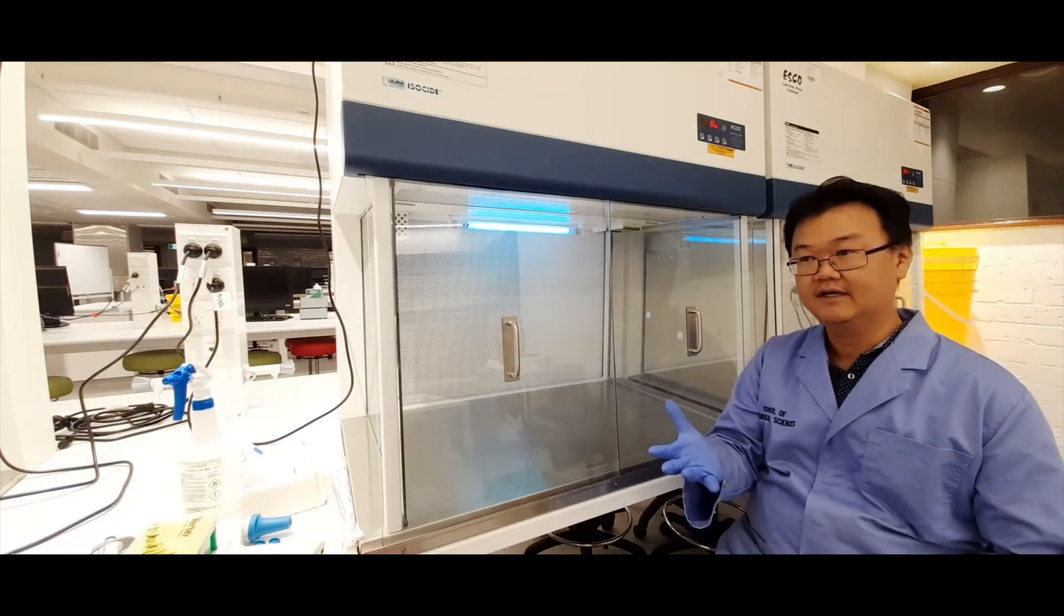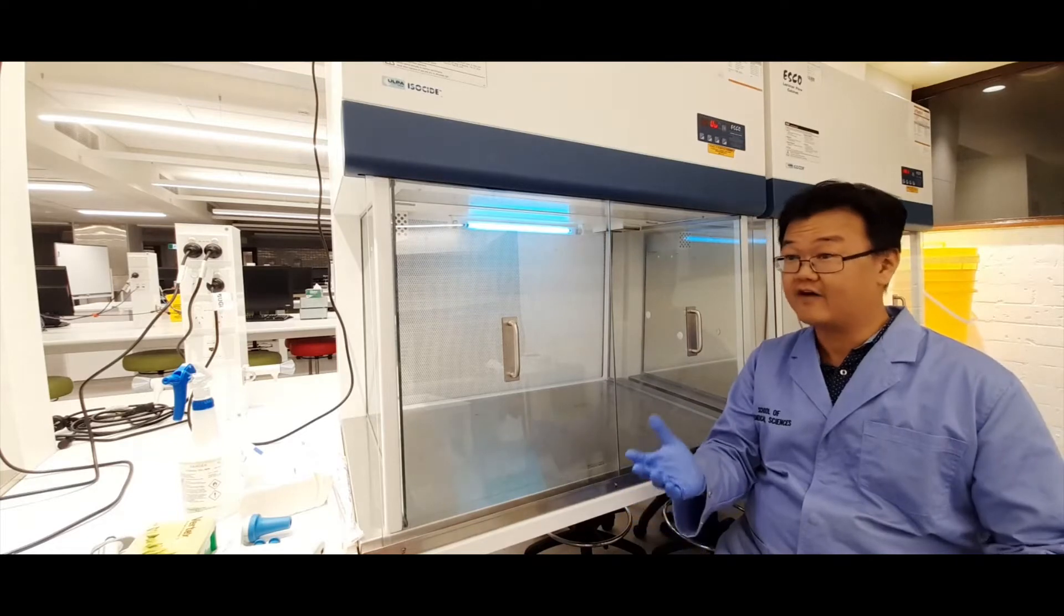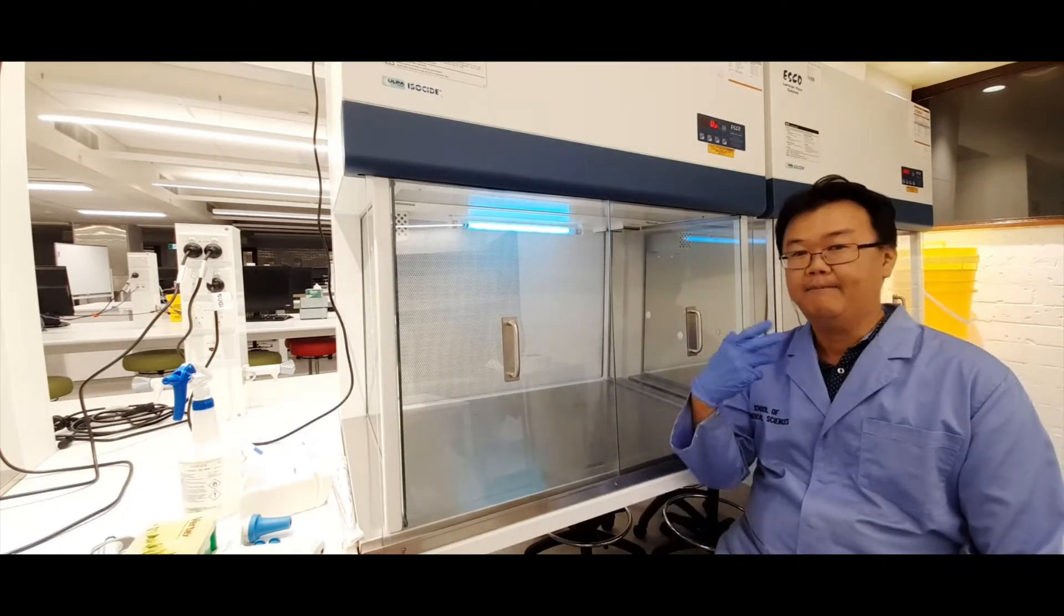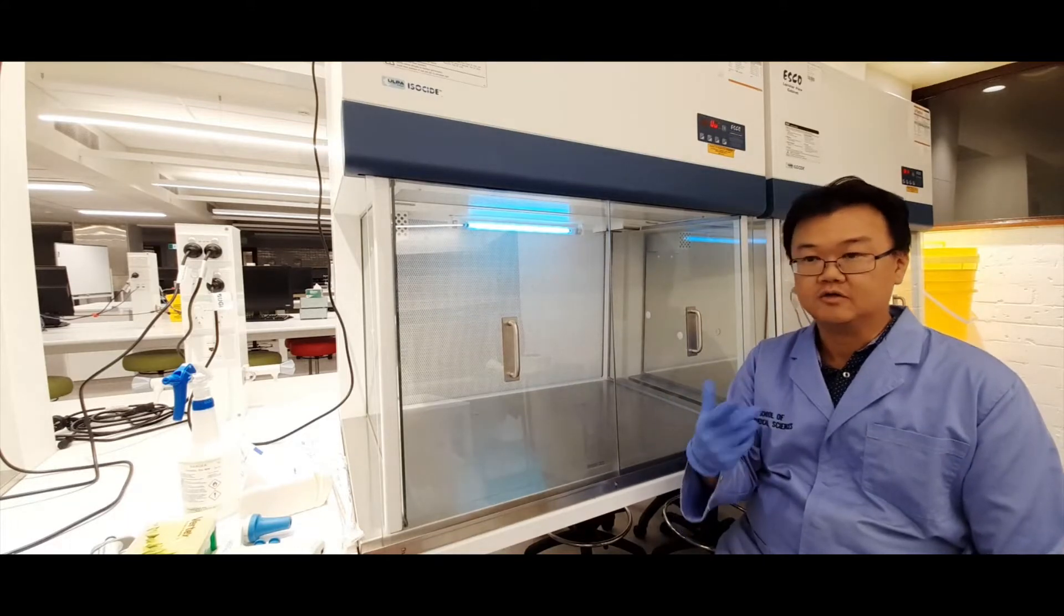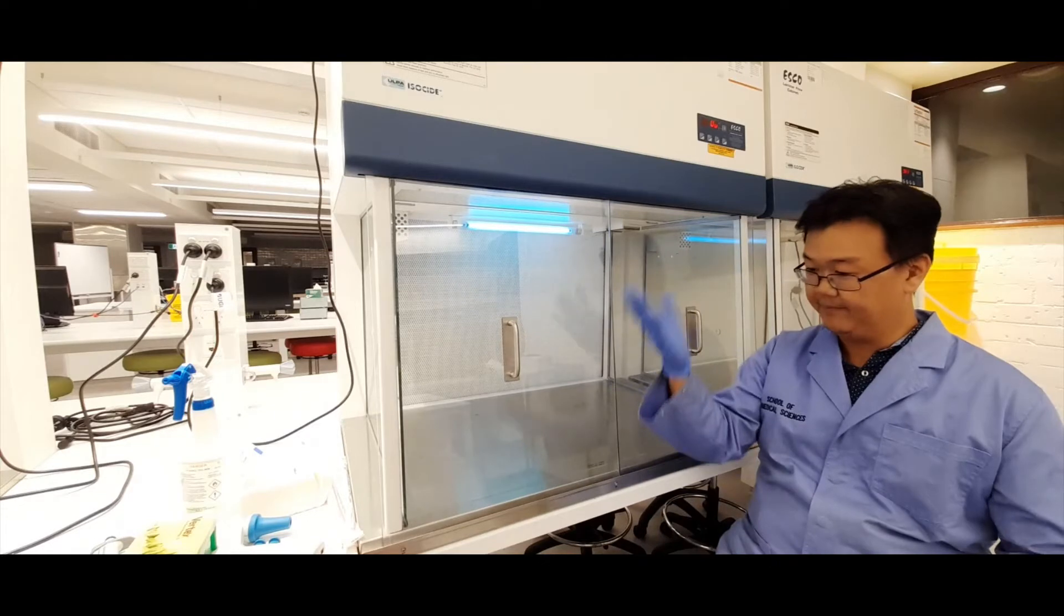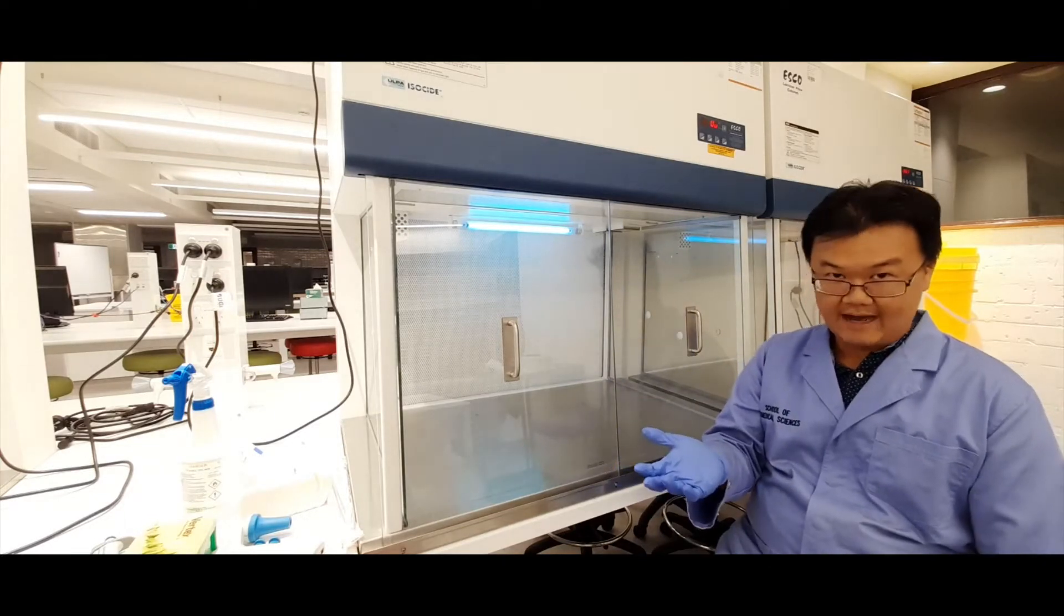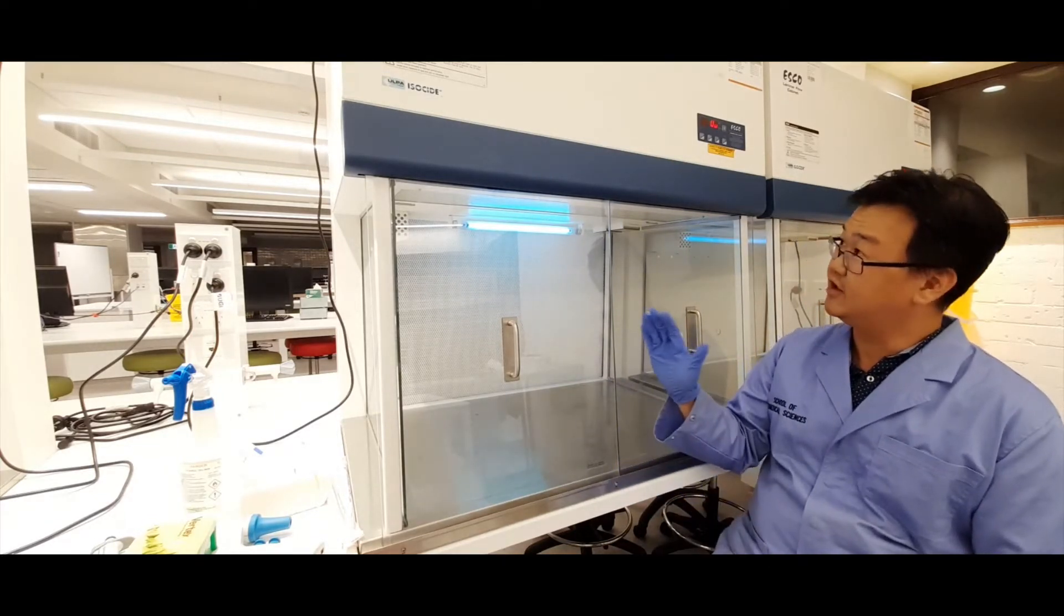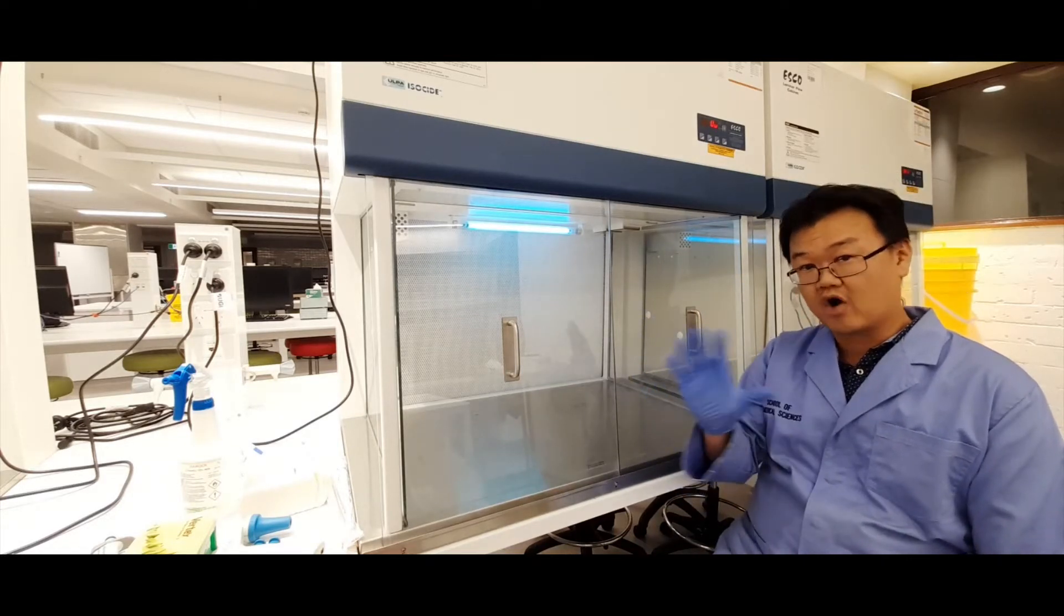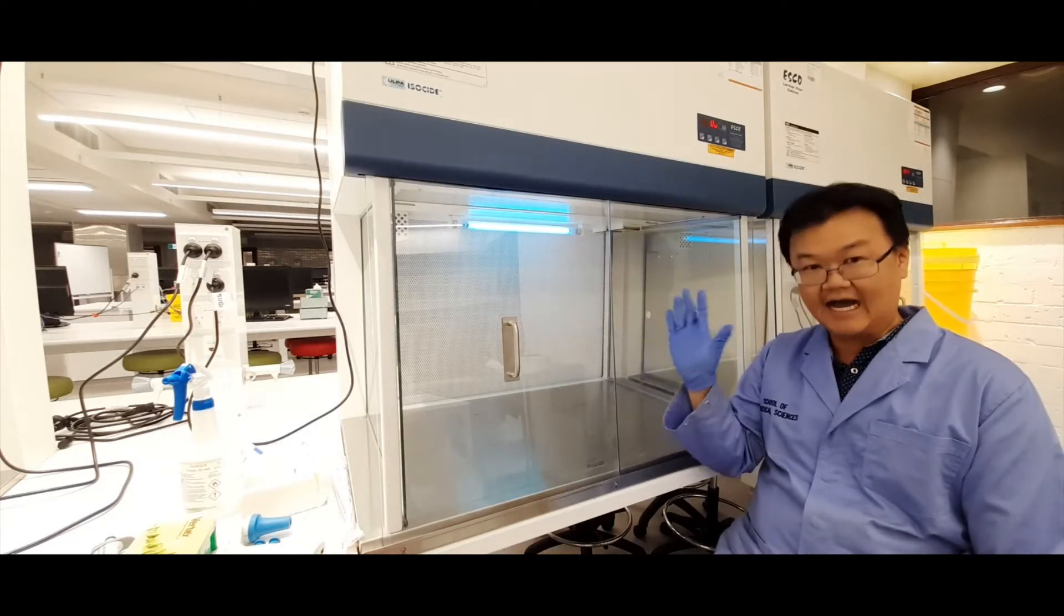As I said, to maintain a sterile work environment to prevent your cultures being contaminated by bacteria or mold or some kind of fungus that's in the air. So I'll show you how to turn on one of these cabinets and how to properly work inside one of these.